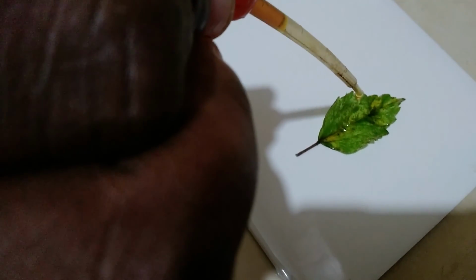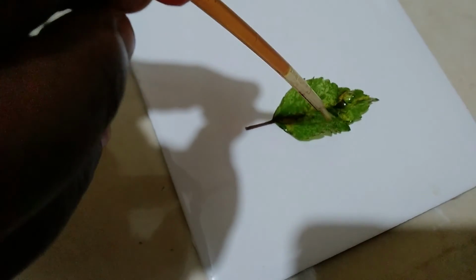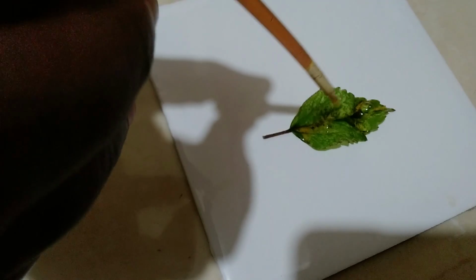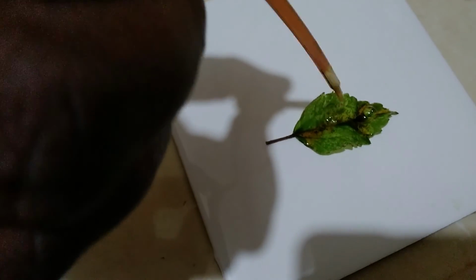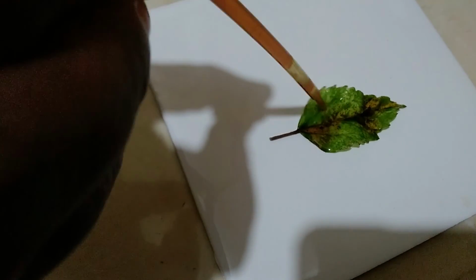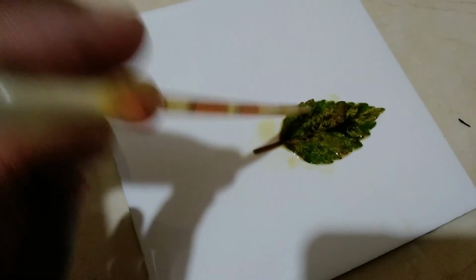So some parts of the leaf had a pretty light color, while some parts had a green color. Now look at what is happening. We're going to give it a little bit of time, and then we're going to look at it, and you are going to do the write-up for this lab. So we're testing a variegated leaf for starch. Let's give it a few seconds and then we'll get back.